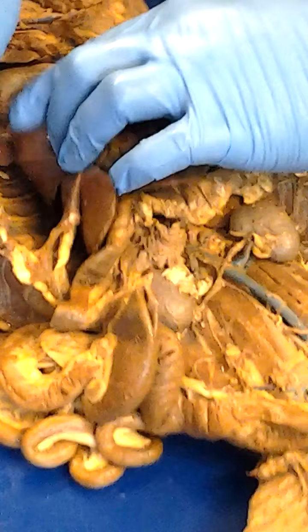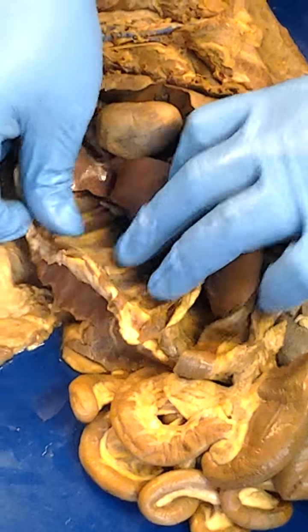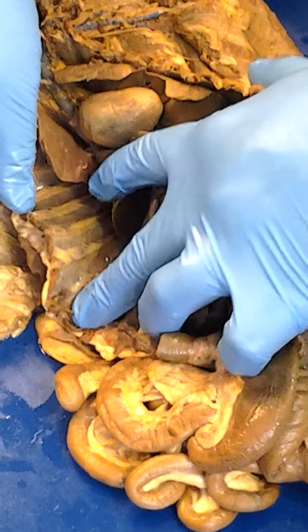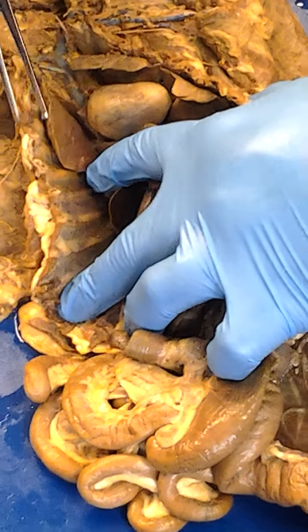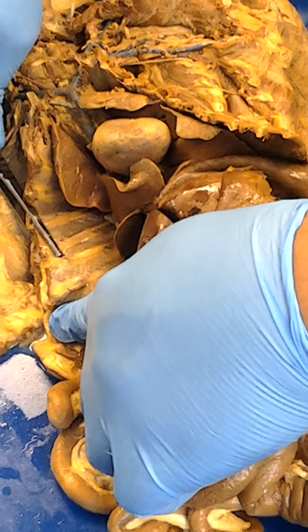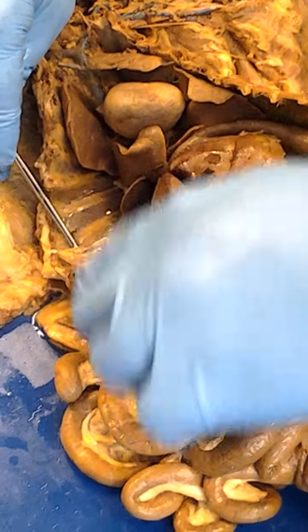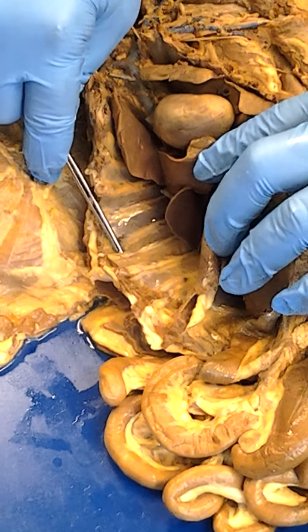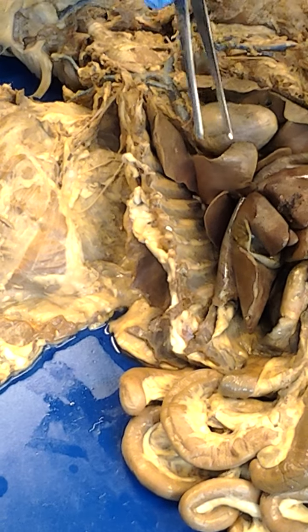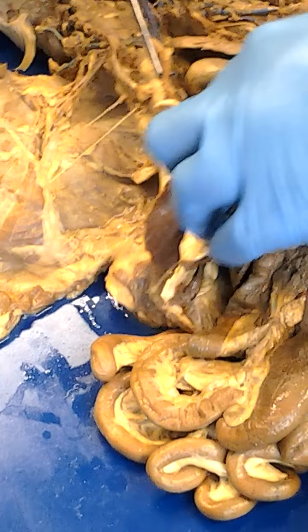Now, can y'all see those blood vessels that are on the ribs there? What are those called? Right there, on the ribs. They're like thin, the little red lines. See the lines right there? What are those called? The ribs. Associated with the ribs. Costal arteries, yeah. Intercostal to be preferred.